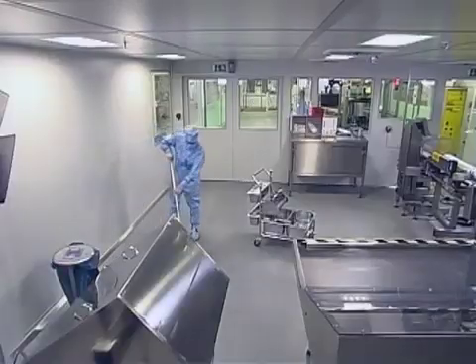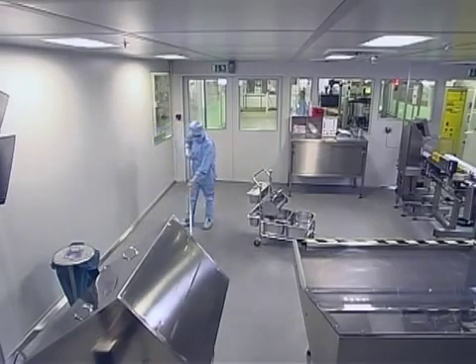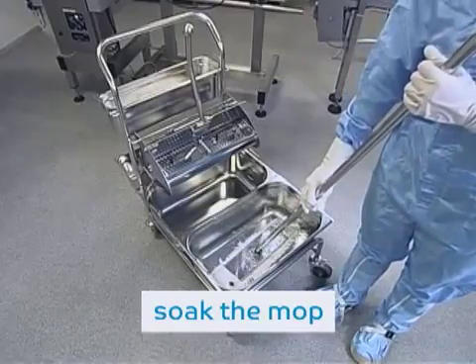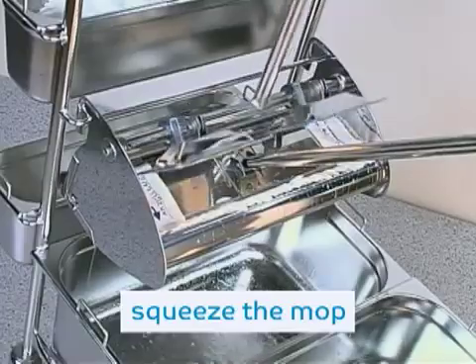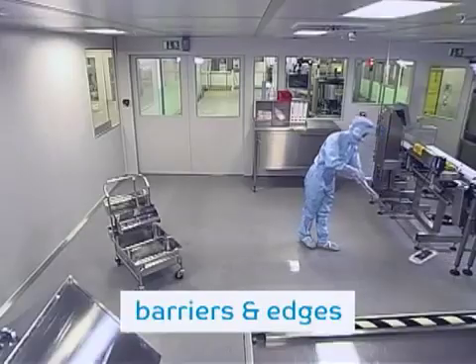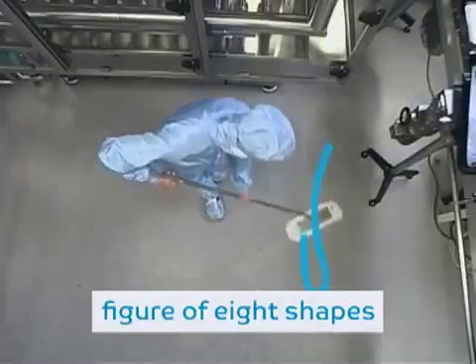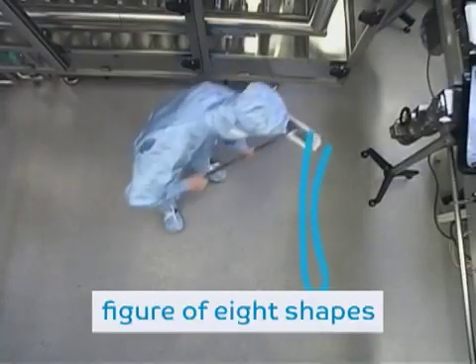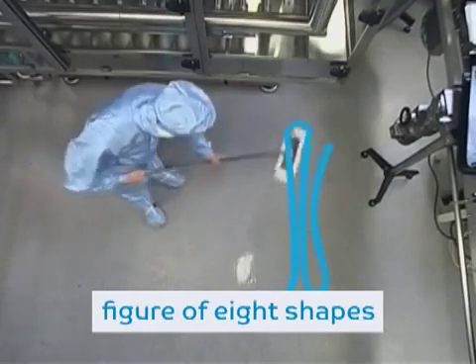This has probably been way too much at once. Here are the most important steps in a short summary. Soak the mop with the fresh mop head with in-use solution in the front bucket and thoroughly squeeze it out using the mop wringer. First, wipe around barriers and along the edges. Then wipe the floor in slow, regular figure of 8 shapes while moving backwards and wiping in one direction only.